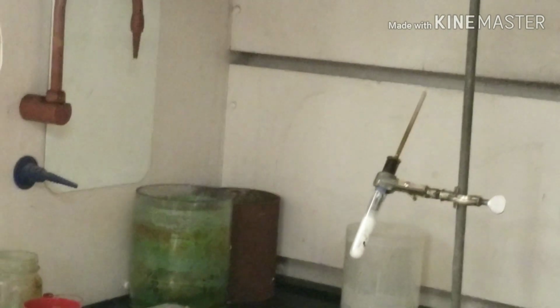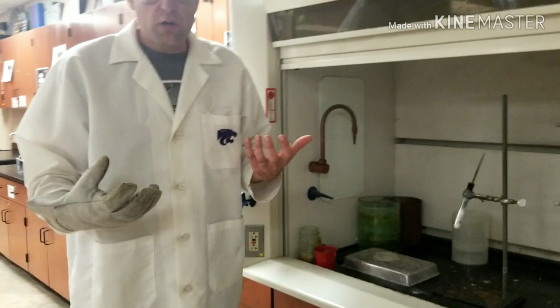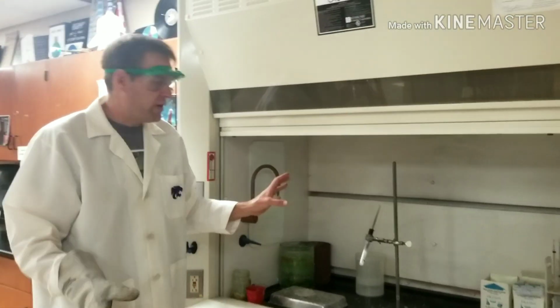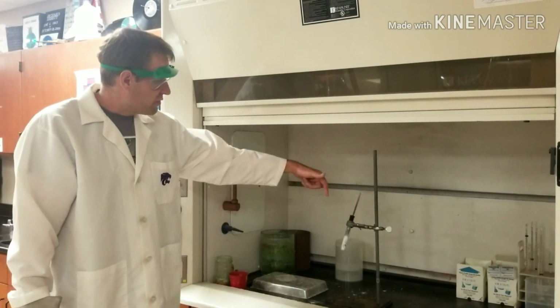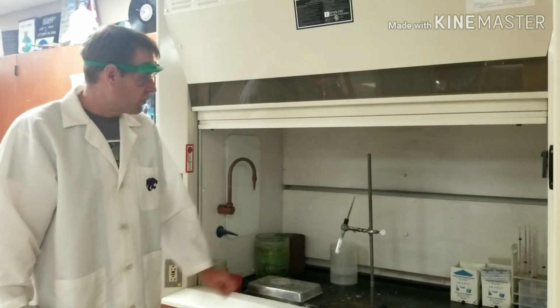Within maybe 10 seconds, we saw that gummy bear, or that sugar, release about 7 calories of energy in very visual form. It'll be very, very hot right now. I've actually done this, and it's gotten so hot that it melted the rubber on the test tube clamp a little bit. So we're going to let that cool.